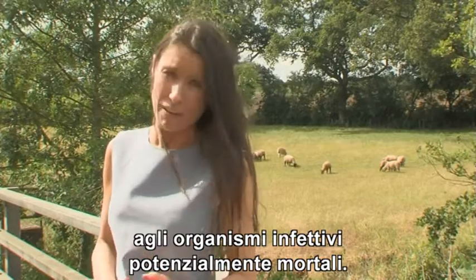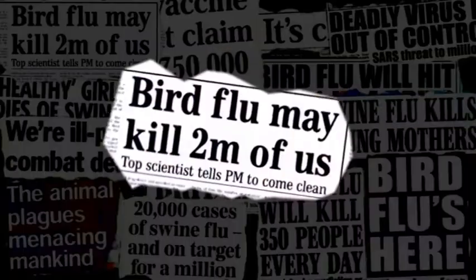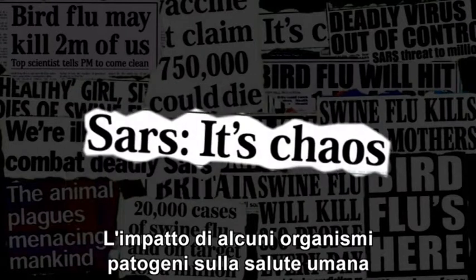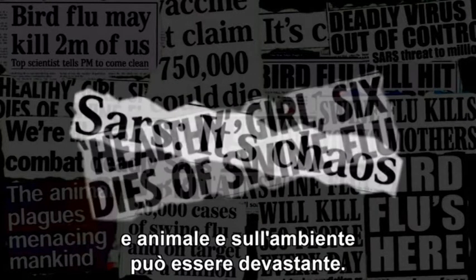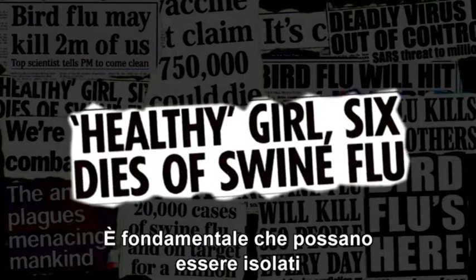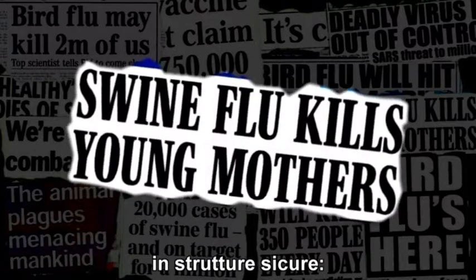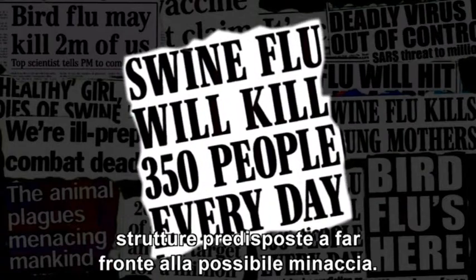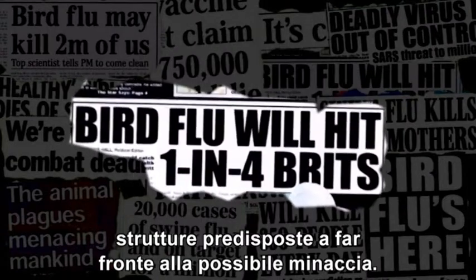potentially deadly infectious organisms. The impact of some pathogenic organisms on human and animal health, as well as the environment, can be devastating. So it's essential that they can be contained in safe and secure facilities designed to cope with the potential level of threat.